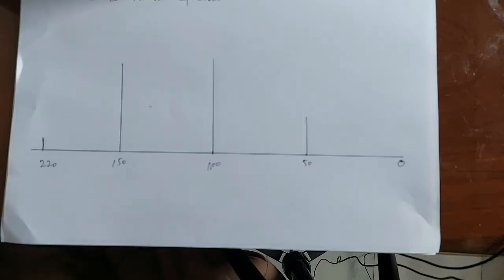This spectra is provided by one of our students, and we have to elucidate it and find the number of carbons in this compound. So, first of all, before moving to the spectra, we have to memorize and understand the ranges of different carbon peaks.